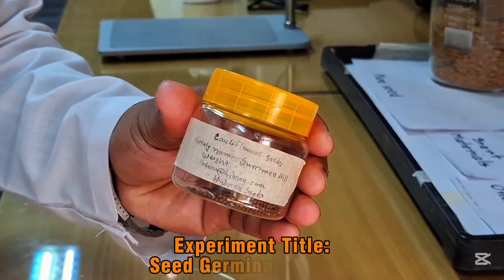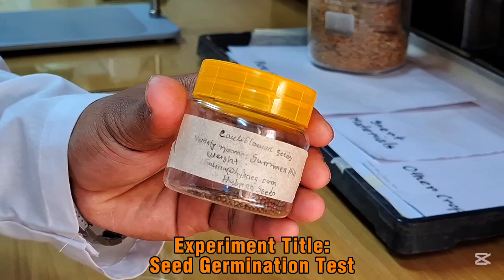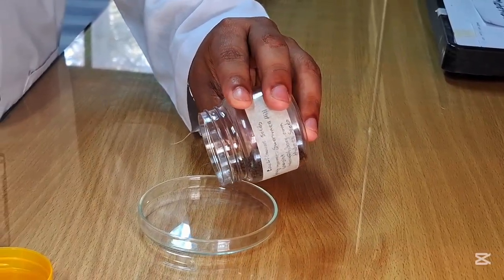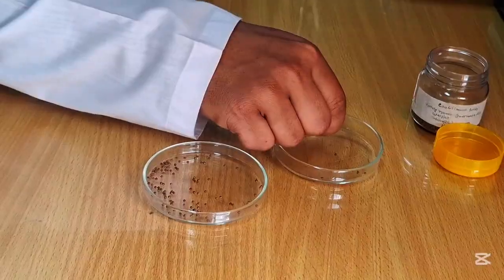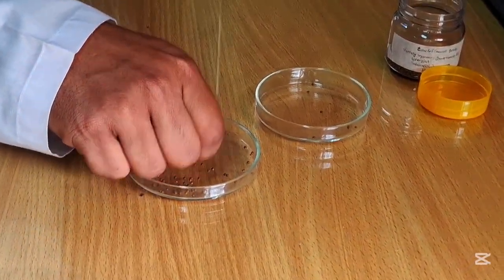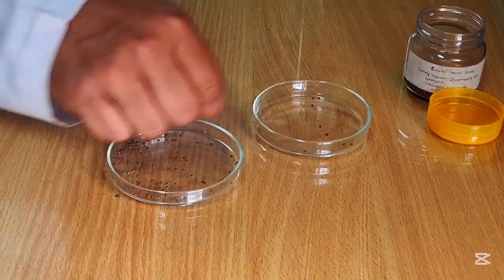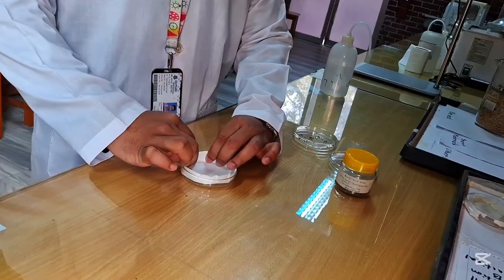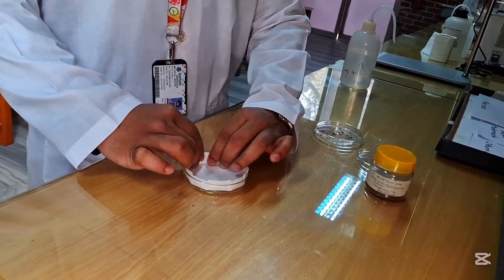At first, healthy and suitable seeds were selected for the experiment. Then, the selected seeds were placed in a petri dish. After that, 50 seeds were counted separately and transferred into another petri dish. In a different petri dish, blotting paper was placed and arranged properly.